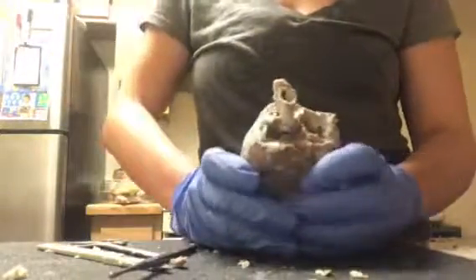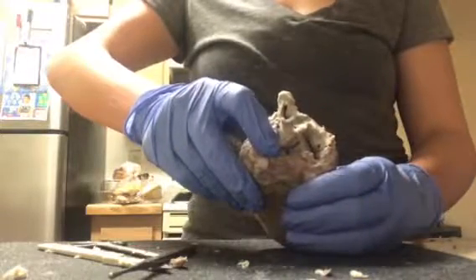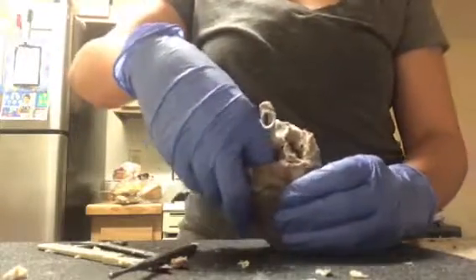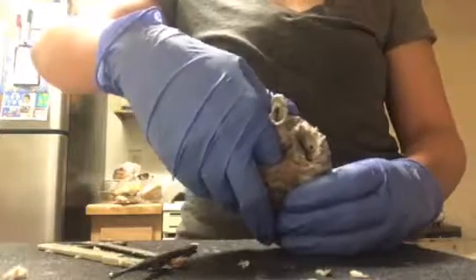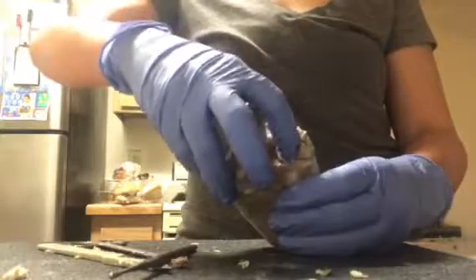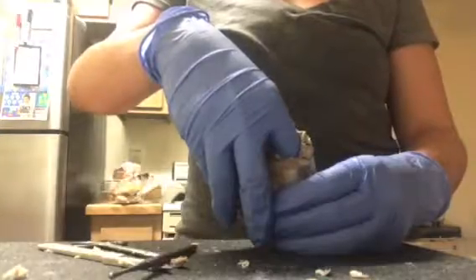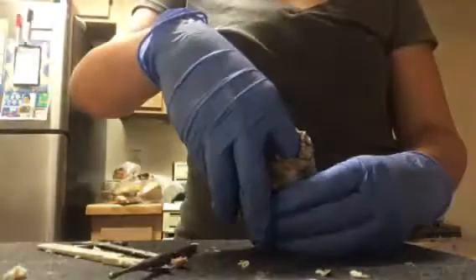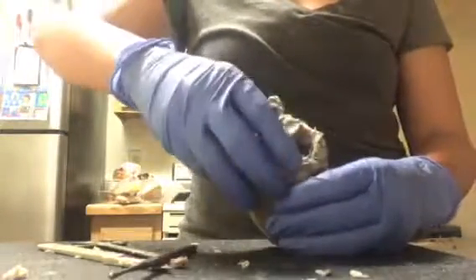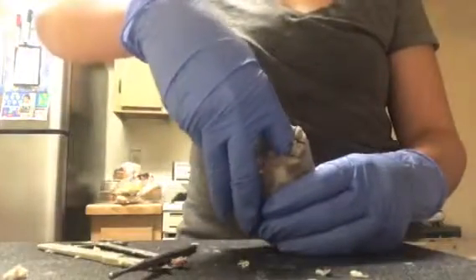To find the pulmonary artery, you can poke down into this left hole, and if you place your finger in, you can feel that it goes very deep inside the heart. And then if you go right over here to this hole, you can poke down and that will touch the vena cava. This one is the superior and inferior vena cava, so that will also go down into the heart.